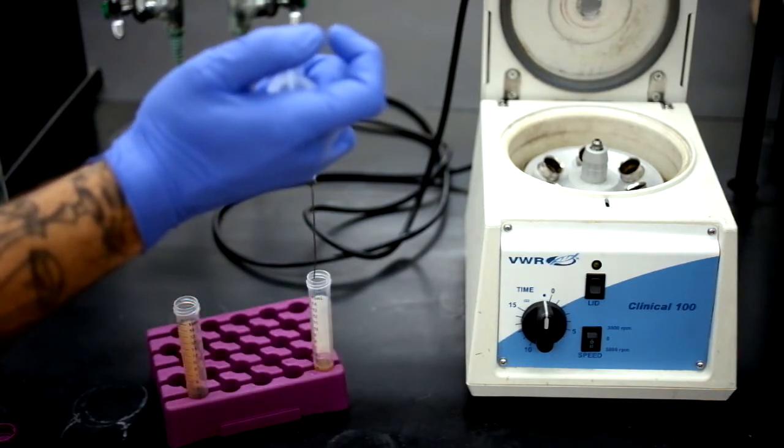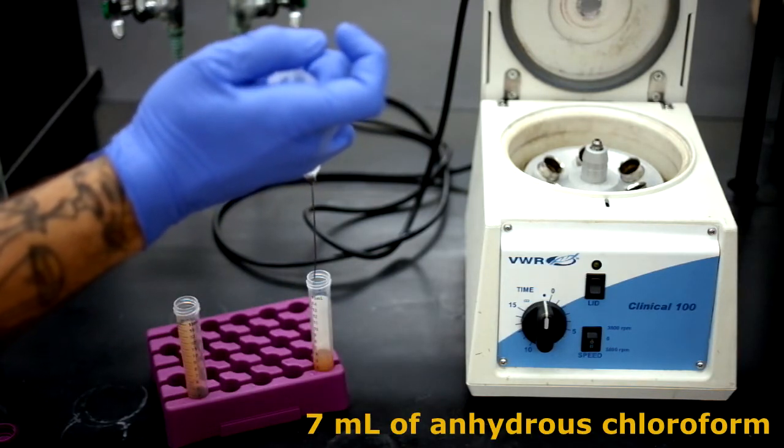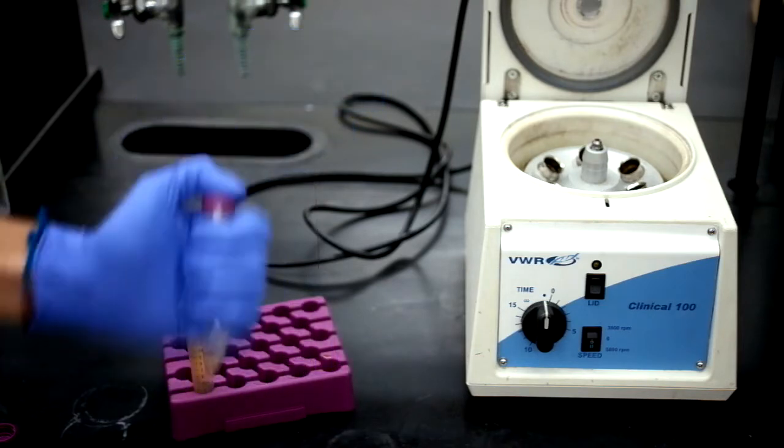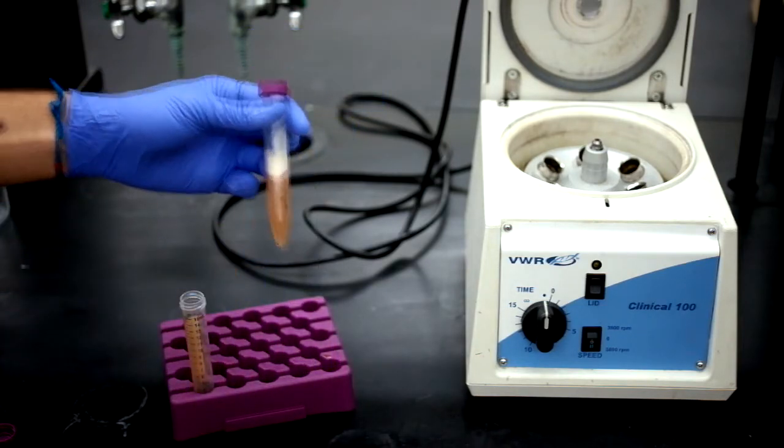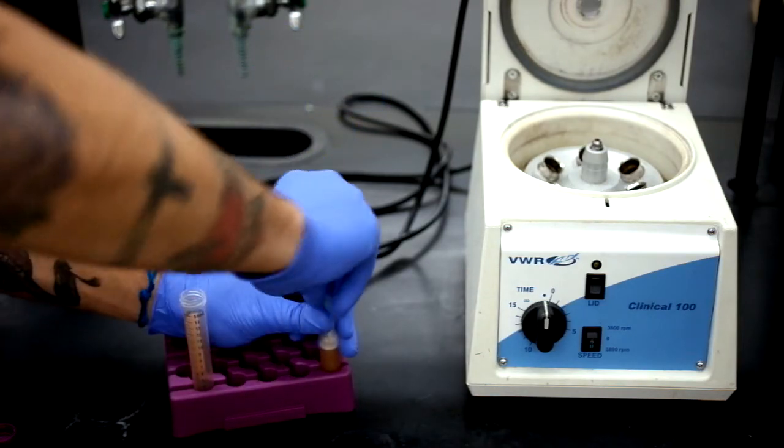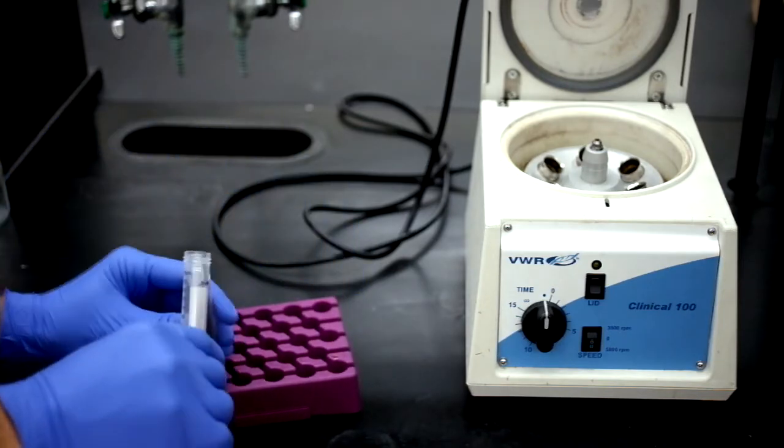With the liquid phase poured off, we can now re-dissolve the nanoparticles in anhydrous chloroform and then shake up the first tube to dissolve all of the particles. You can then use the same solution in the second tube to dissolve the rest of the particles.